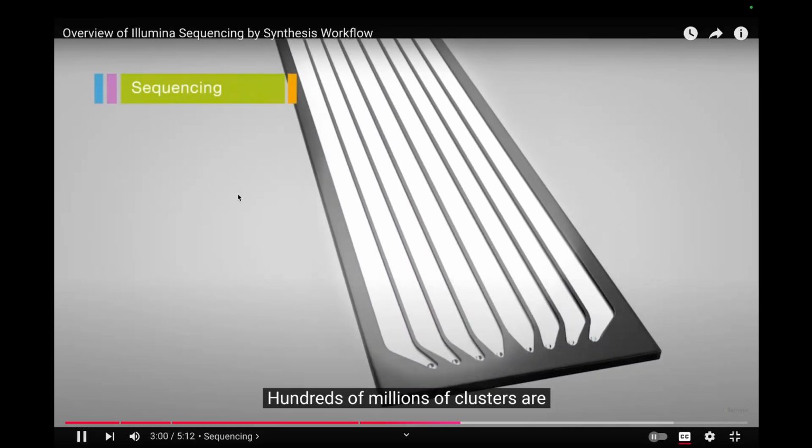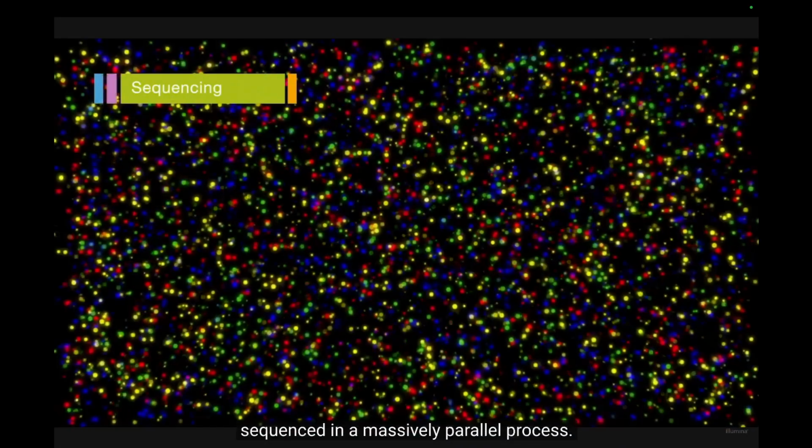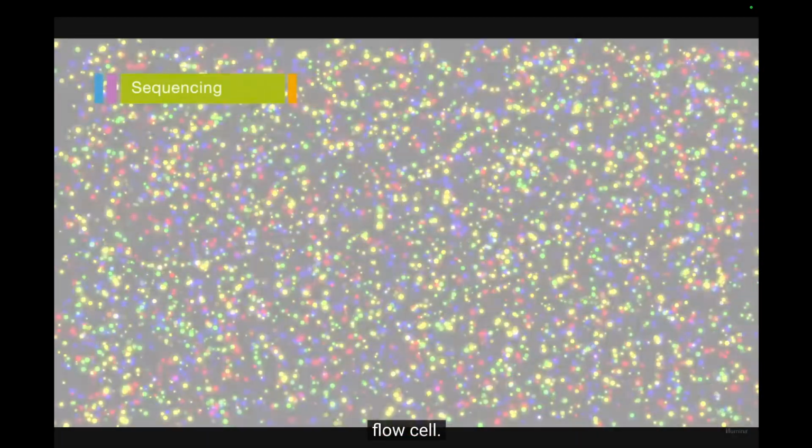Hundreds of millions of clusters are sequenced in a massively parallel process. Yeah, this is the image the sequencing machine captures. So at every position, you know what base is there, you know from what flow cell that signal is coming, and the base caller will know, if that particular signal has come, what is the complementary strand for the DNA. This represents a small fraction of the flow cell.